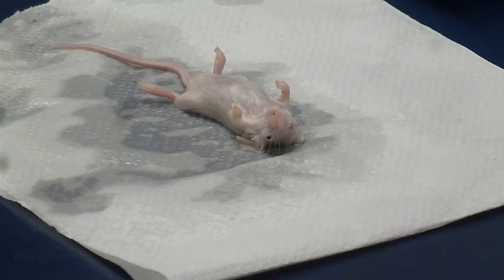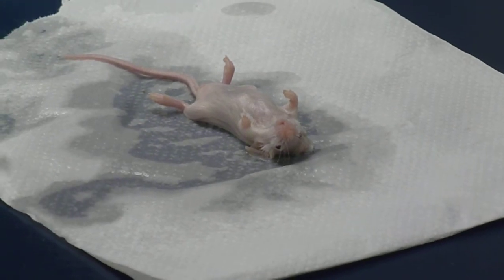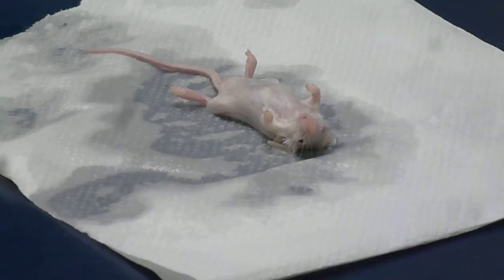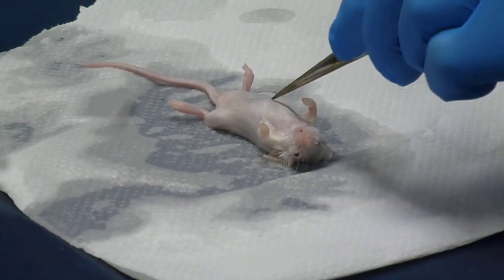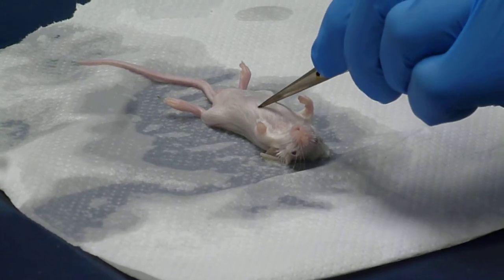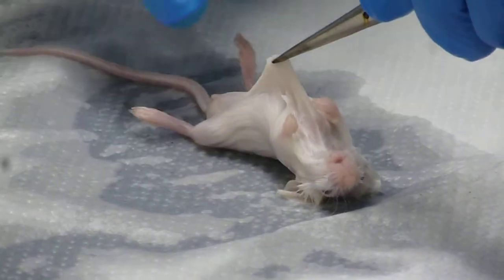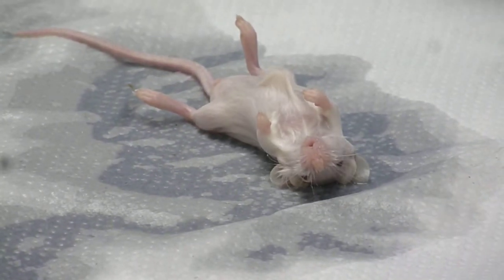What we're going for here: right now I have to sterilize these, but you can kind of see this. The end of the chest — the rib cage is about right there. What I'm going to do is snip the skin right in that area and do the peeling from there.